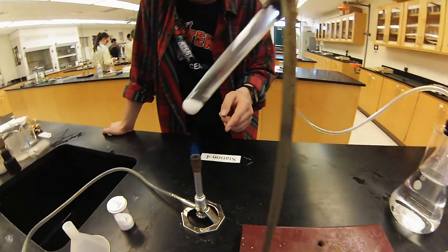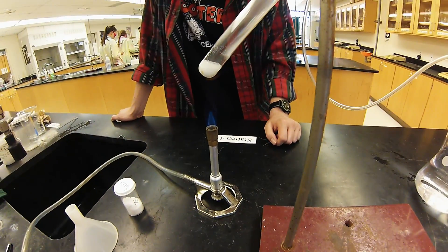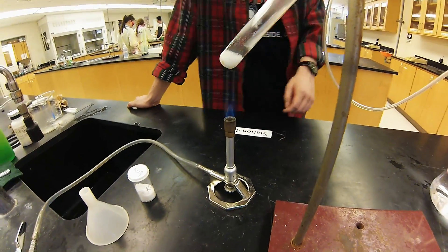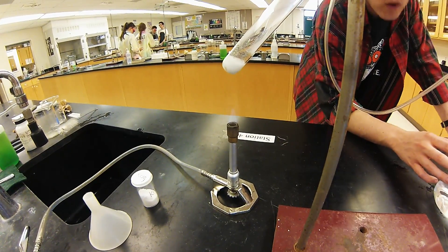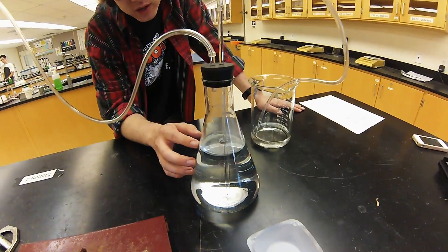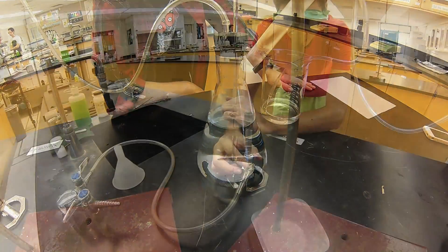At this point, it's bubbling at a much faster rate. So a lot more gas is being produced and in turn a lot more water is being displaced in our Erlenmeyer flask. We're about done here.